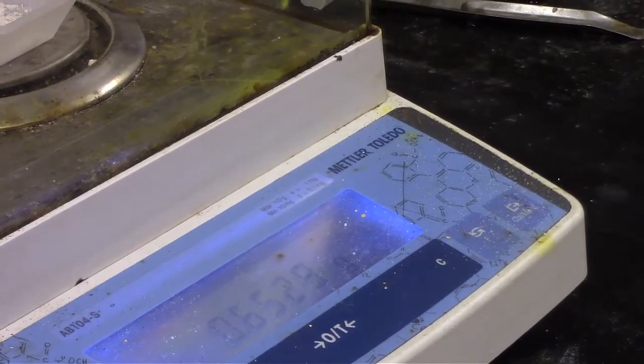After the zeroed weigh boat, it looks like we have 0.6530 grams.